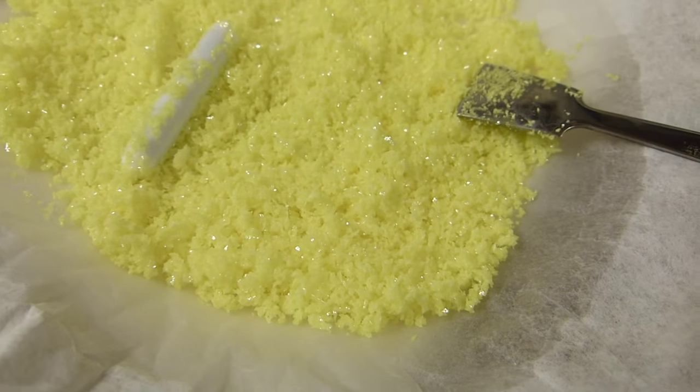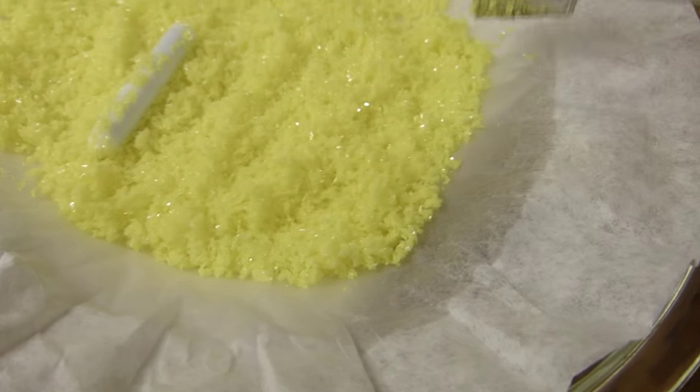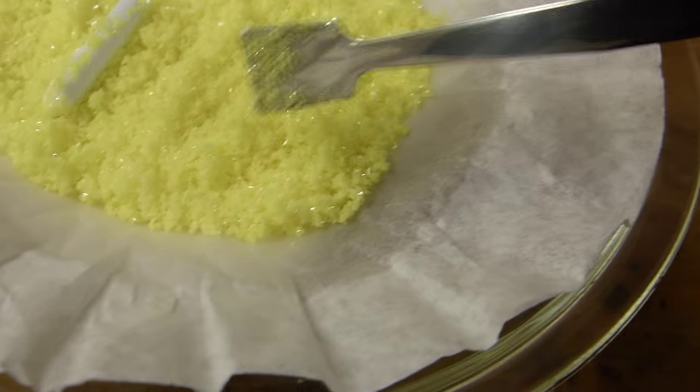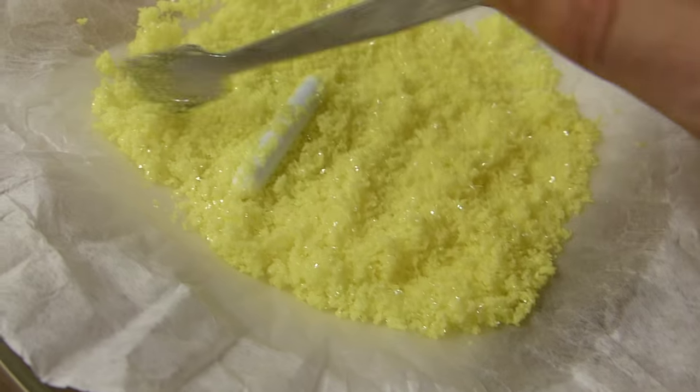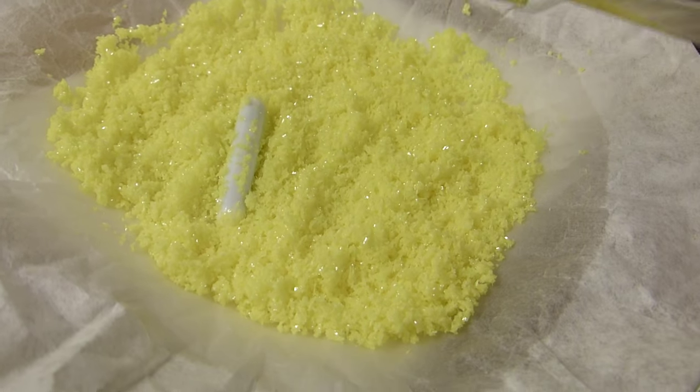So here we have our almost dry crystals of pure sulfur. You can see the xylenes have soaked the paper towel. But they're evaporating very rapidly and we should have within the hour some dry free-flowing sulfur.